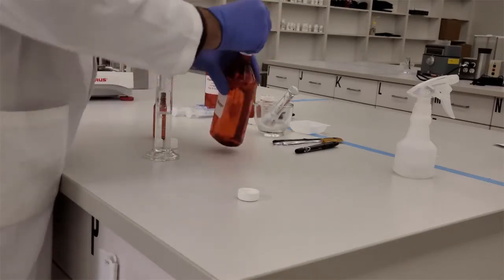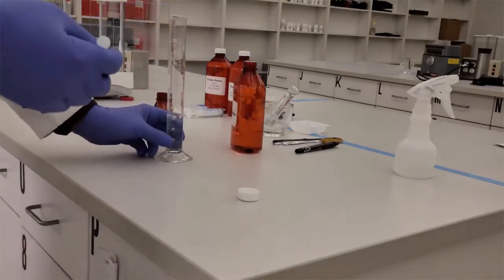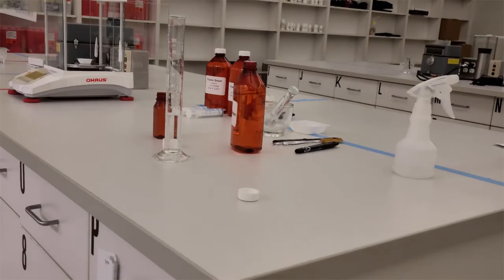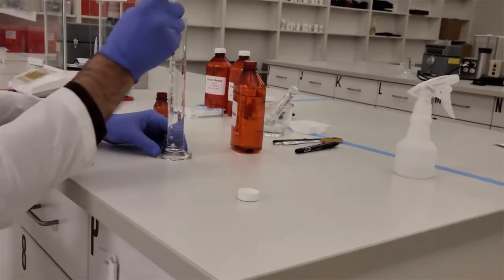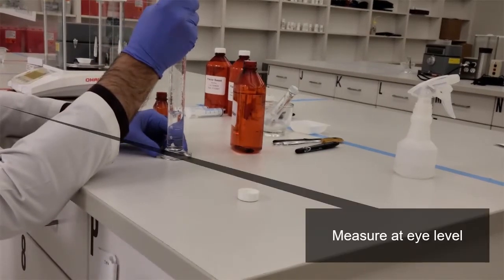What I like to do is to get very close to my number 35, and then I get a small oral syringe. I fill that with water, and then I'm going to basically drop the water down to get it to the exact amount of 35 mLs.